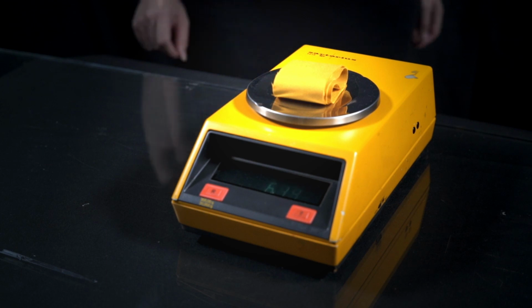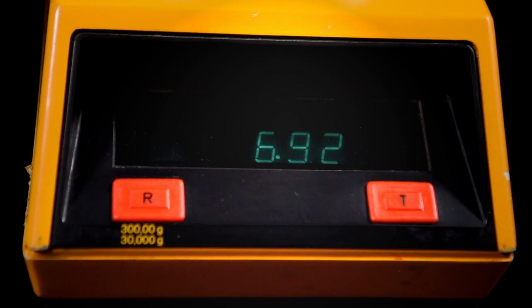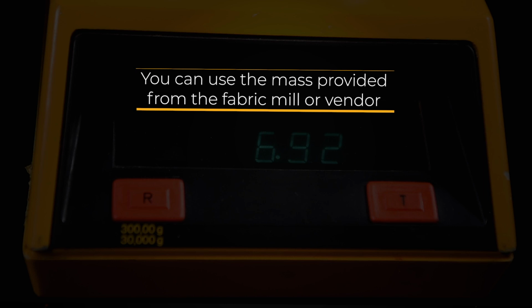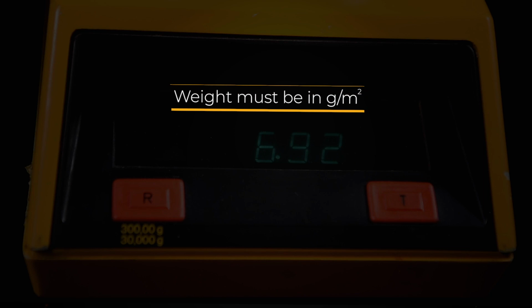Place all 3 fabric strips on the scale for the total weight, then calculate the average by dividing the total weight by 3. Record this number as it will be used later in the testing process. Alternately, you can use the mass provided from the fabric mill or vendor if you prefer not to weigh the fabric yourself. Weight must be in grams per meter square.